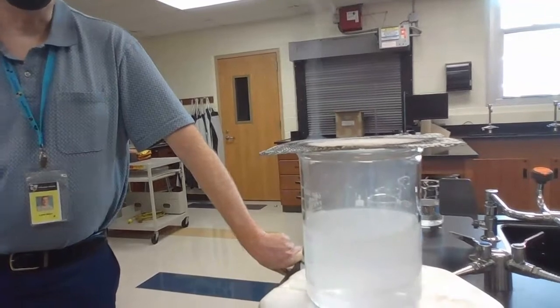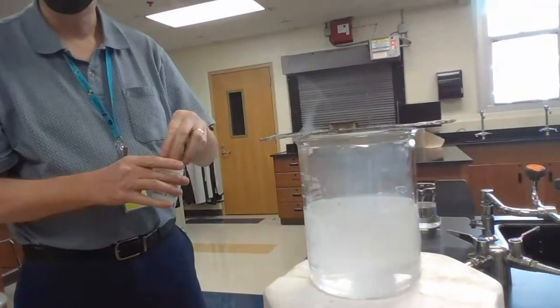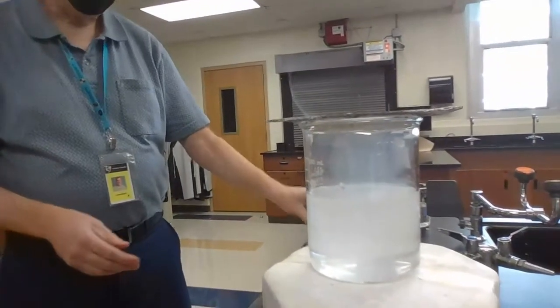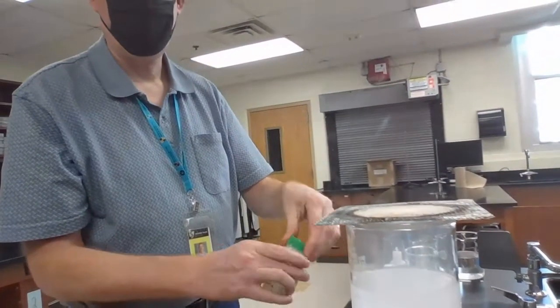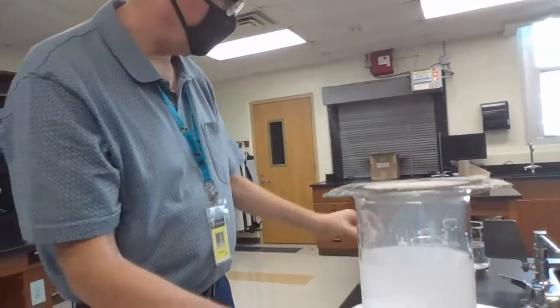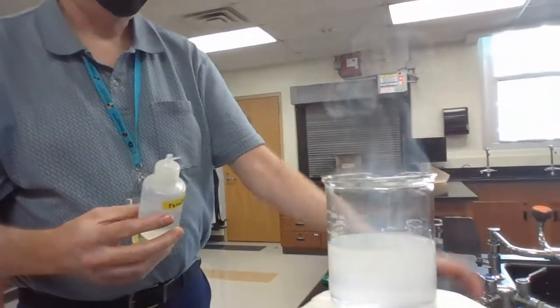So compared to the last one, would you say this is faster or slower? I would say that this one is faster than the lithium was. I think so too. I think it definitely went faster than the last one. Oh gosh, and I know you guys probably can't see it, but there's quite a lot. Oh yeah, you can see it. The little wisps of gas that are coming off of that. So there's a lot more gas that was created.